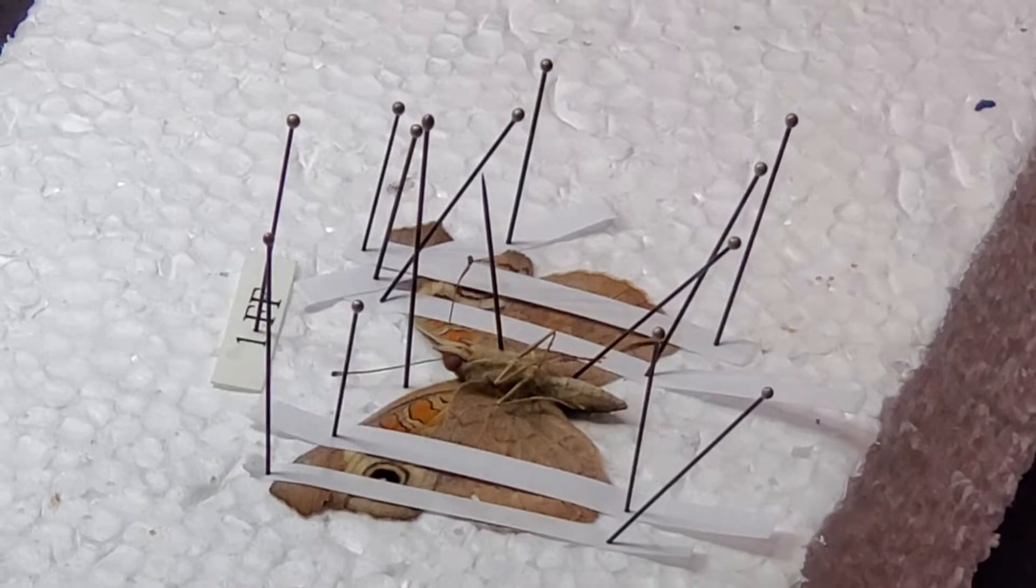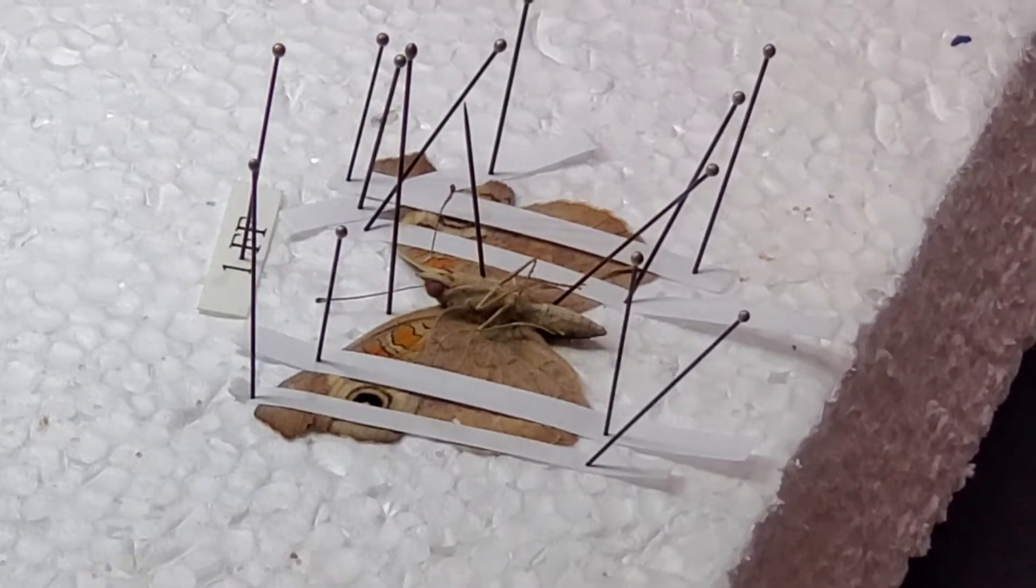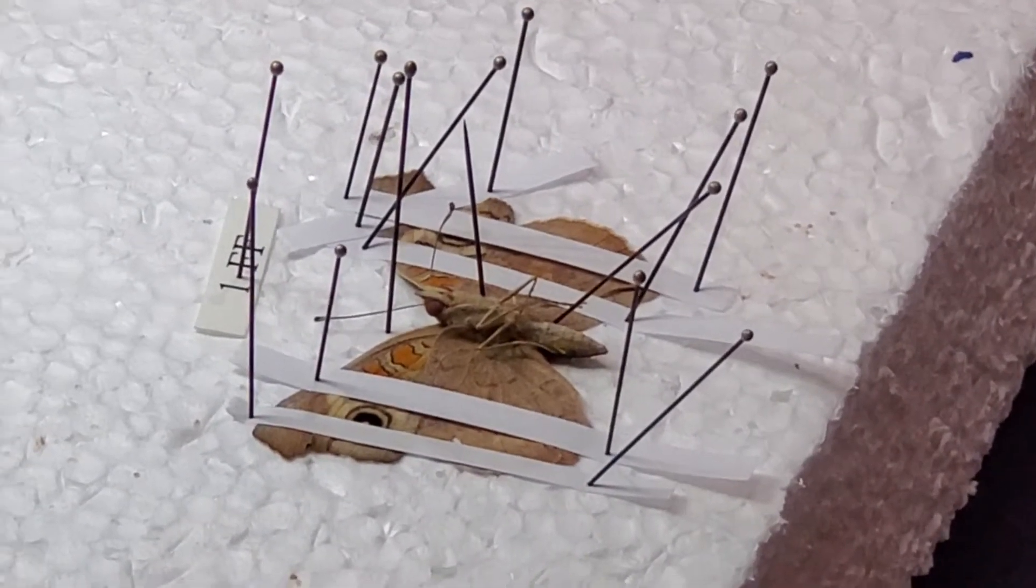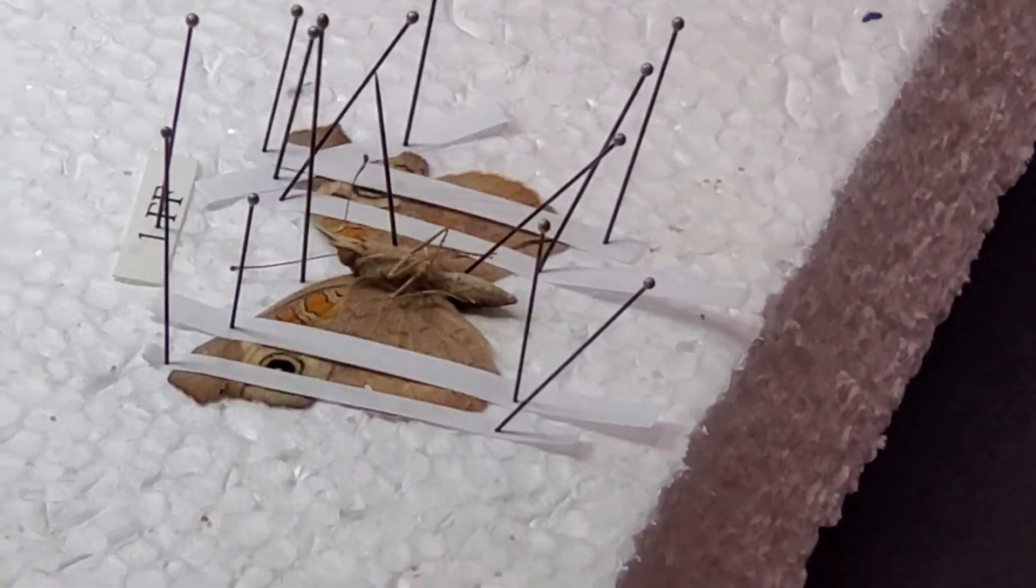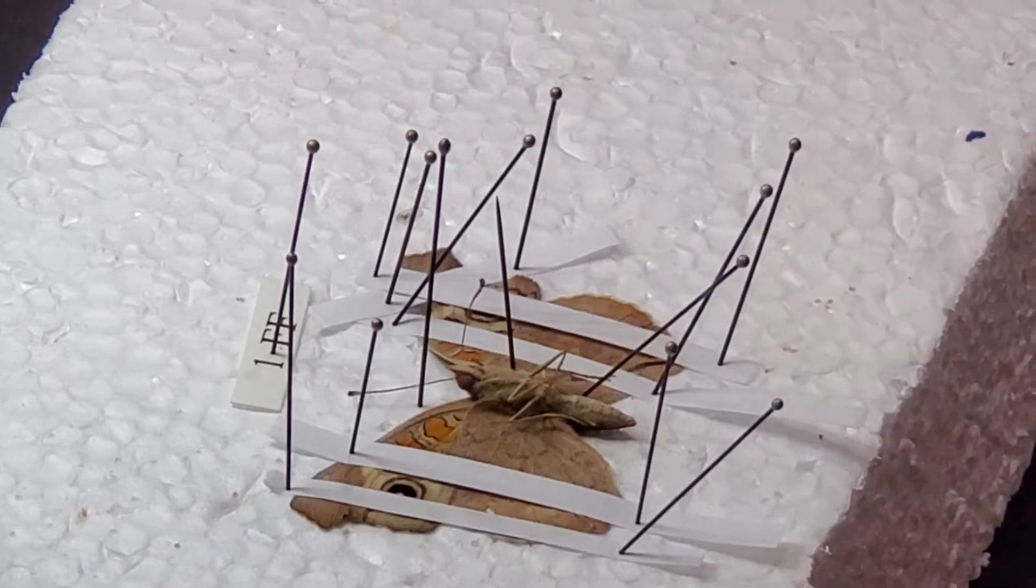On the label is the date you caught it. Not the date you pinned it, not the date you traded with somebody else, not the date you pulled it out of the freezer or anything else. It's the date you caught the specimen. I think that pretty well covers it.